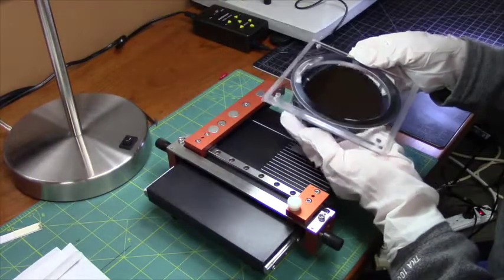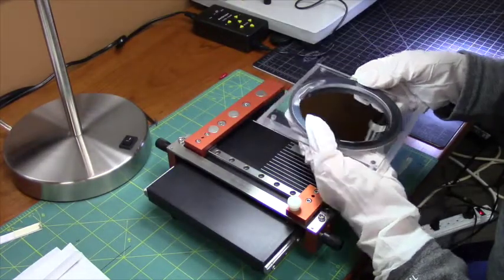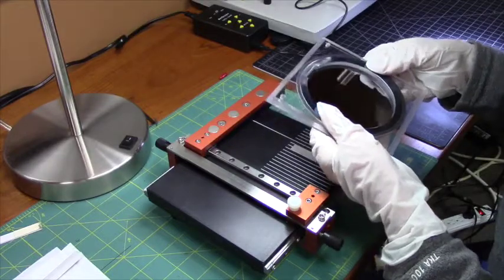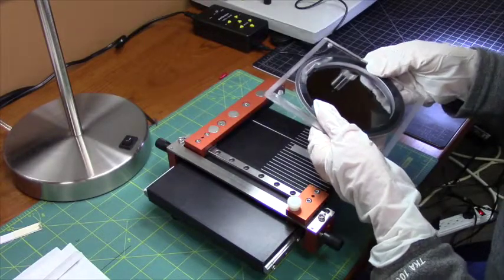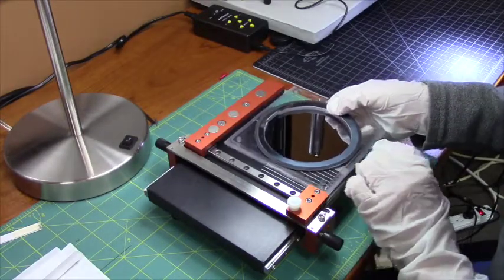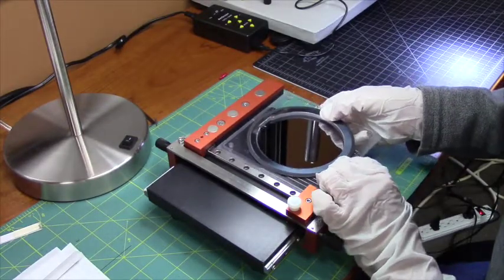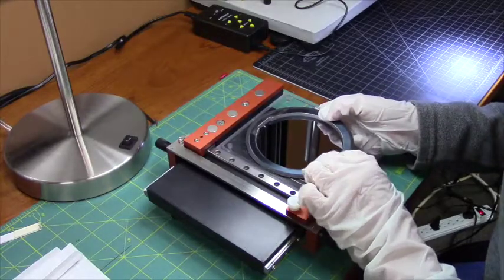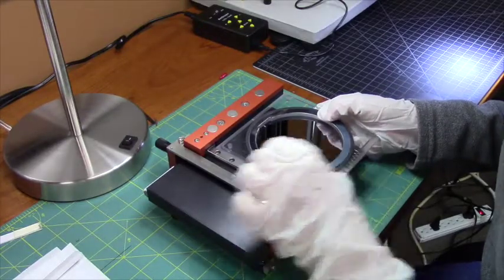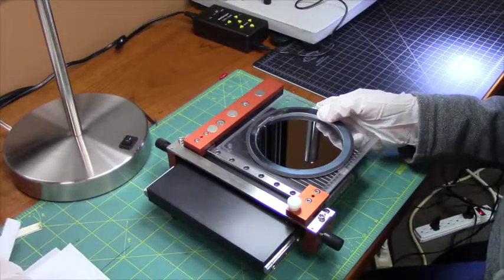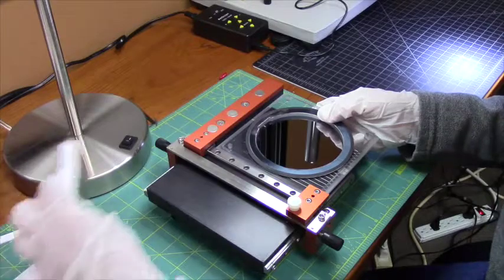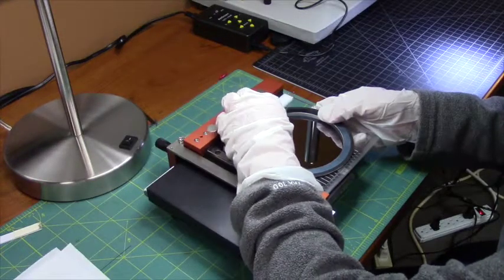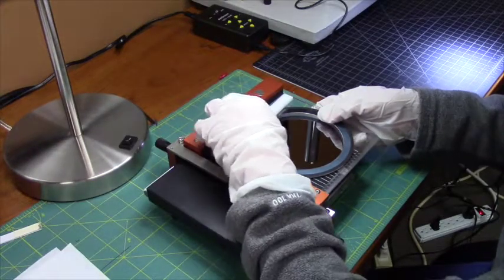We put the wafer into the wafer holder. It is very useful sometimes to use a cleaving mat to do this. That way you can use the ruled markers to make sure that everything is aligned properly.